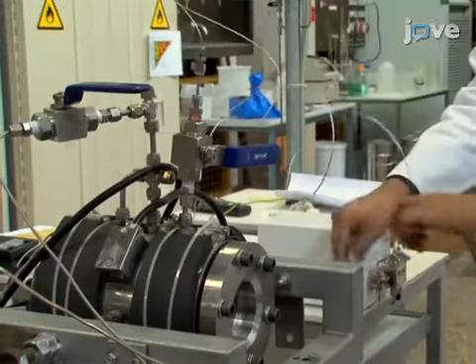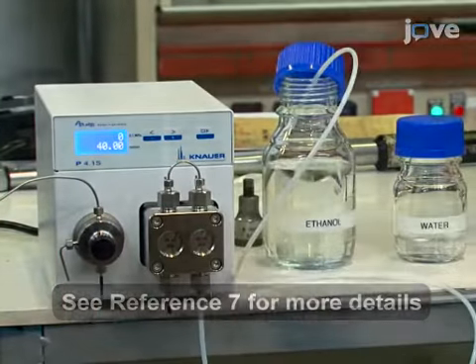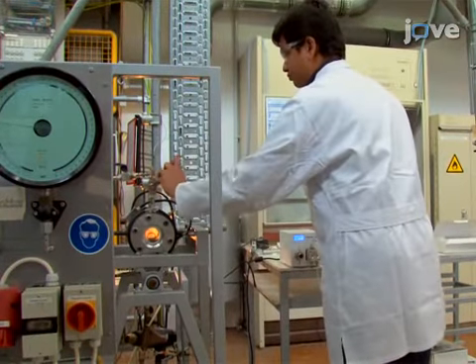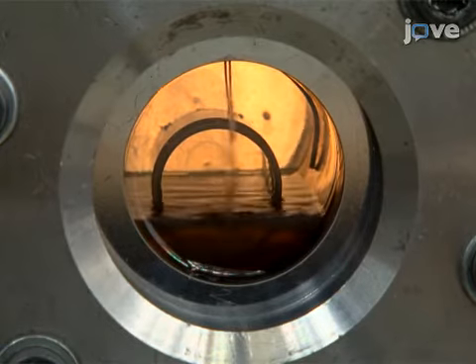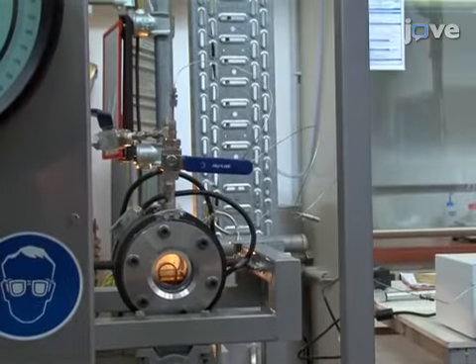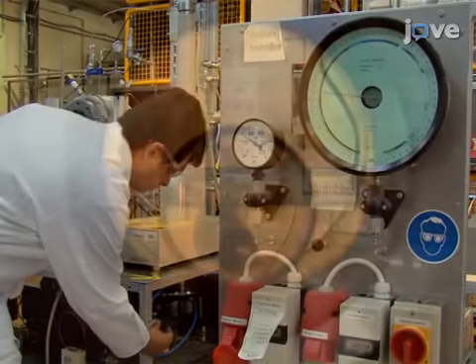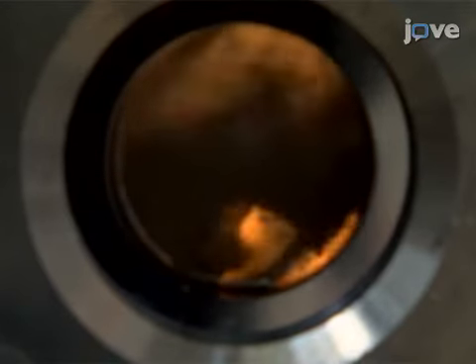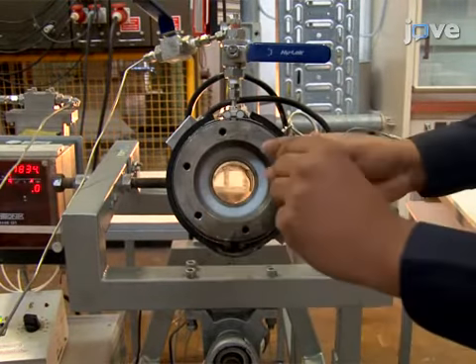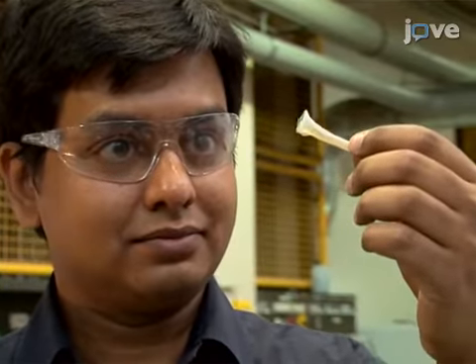An alternative to depressurizing is to start the solvent exchange in the pressurized autoclave. To accomplish this, pump the ethanol water mixtures into the autoclave stepwise, ensuring the gel remains submerged in the liquid. This takes about 90 minutes for a 2 mm gel. Once the desired solvent concentration is reached, commence with supercritical drying by increasing the pressure from 5 to 12 megapascal using supercritical carbon dioxide. For a 2 mm gel, the process of gelation, solvent exchange, and drying should only take about 3 hours.